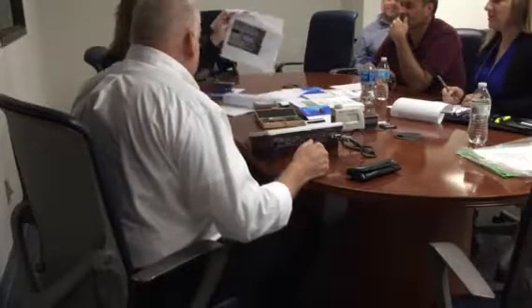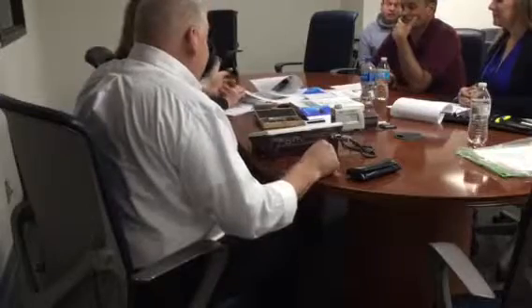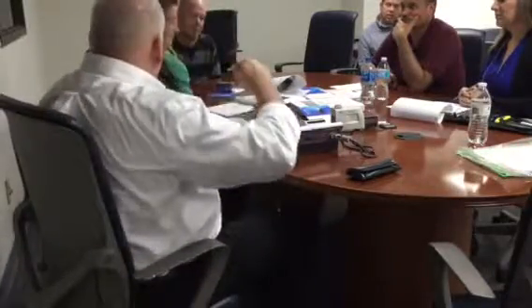We honestly don't even know who made that. We really don't. I'm going to guess it was the previous quality manager, Mohammed, but we don't know. Pretty good. Again, the only thing I've got against it is it's using the R profile. So with the R profile, you've got a step in there, it's going to filter out the step. And that's why when you look at his trace, it's not a step anymore, it's a V.